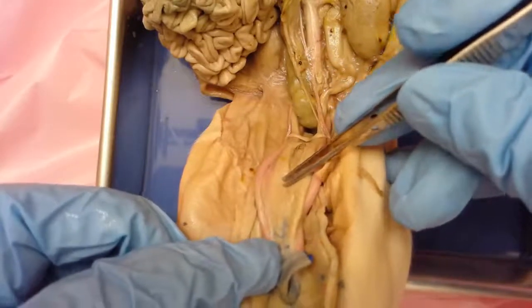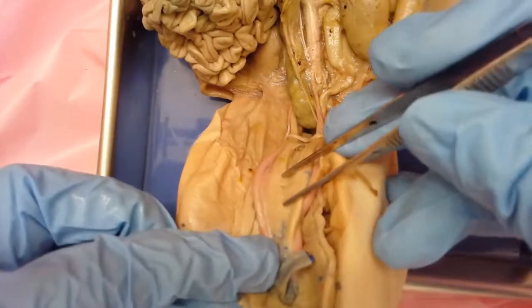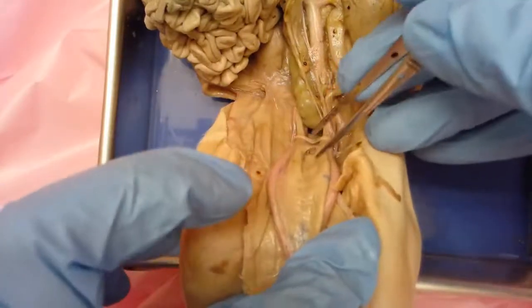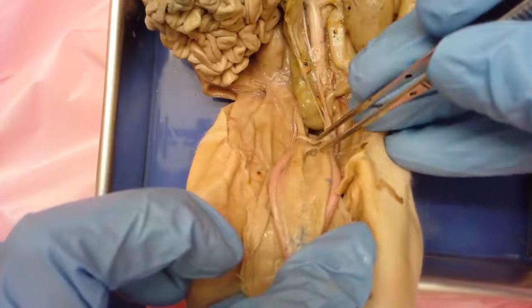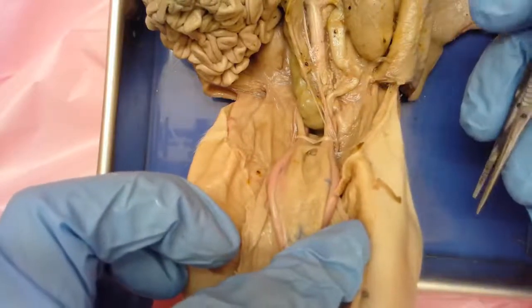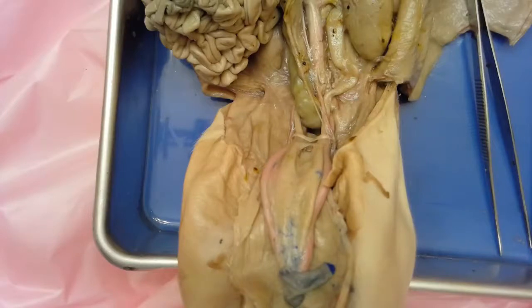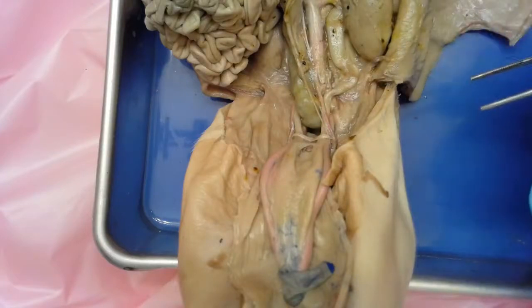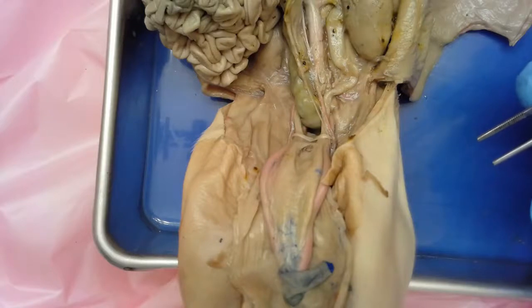Urine exits out of the urethra. The urethra looks a little different in males and females. This is the male specimen, so we're going to dissect a few things, then come back and talk about the reproductive system, and revisit where that urethra is. We'll also look at where it's located in the female as well. If you need time to review the structures associated with the urinary system, make sure to do that, and watch the other short video linked in the instructions that gives an overview of the process of producing urine.